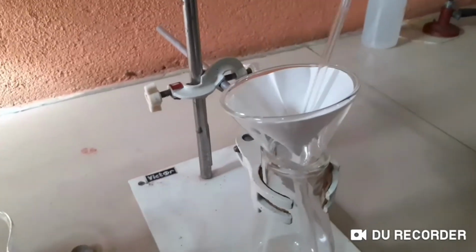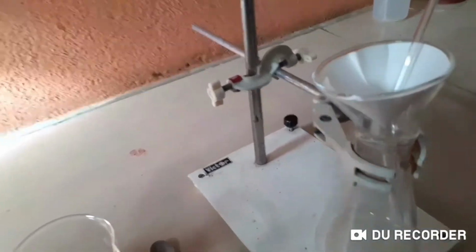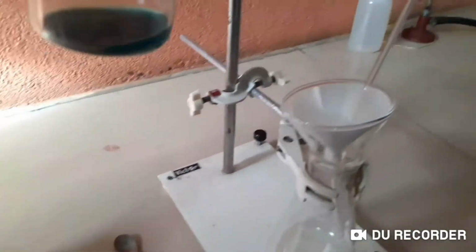Okay, someone has to hold this. Hold it like that, okay? Don't push it onto the paper. We are going to pour. You call it actually decant. Can you see now the little bit of color you can see actually? You can see that blue color. Can you see that? Yes, right, from this actually you can see.